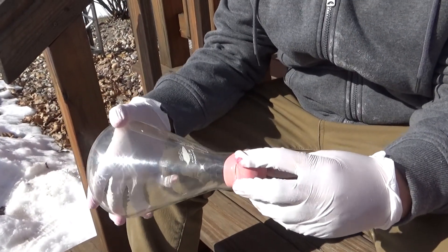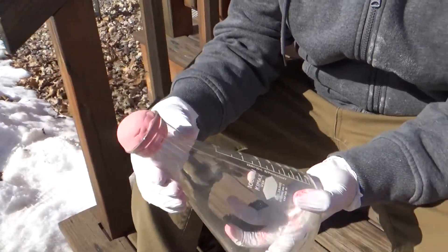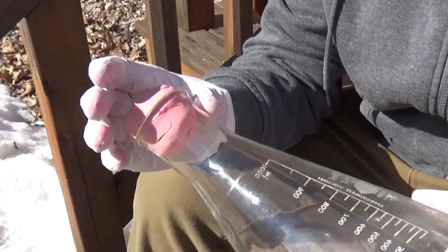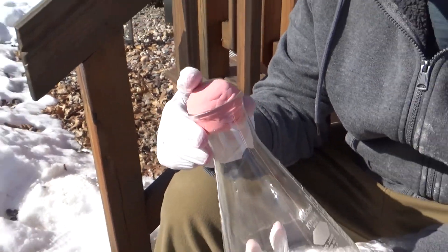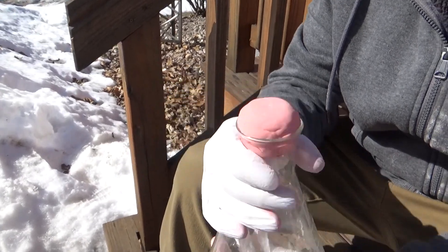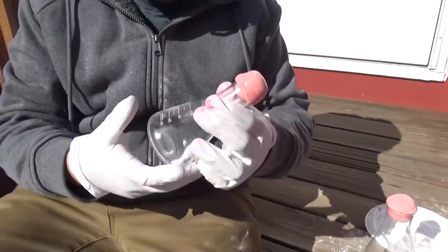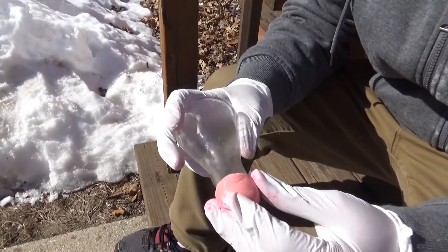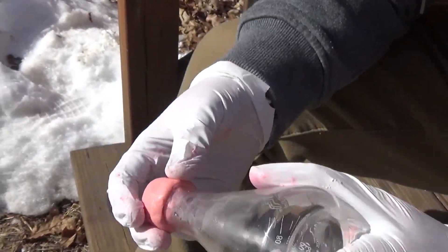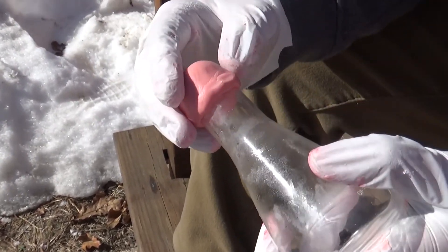Here is the first stopper — I basically just molded it into a ball and pressed it right into the flask, so now it's a perfect shape. I'm going to try to flatten the top so that later on I can put a hole through it for glass apparatus. For the second one, I tried something a little different and molded it around the top of the flask itself — hopefully that will create a seal.